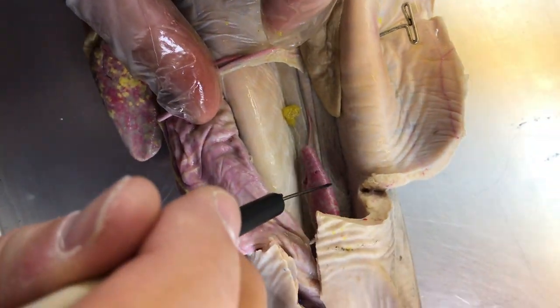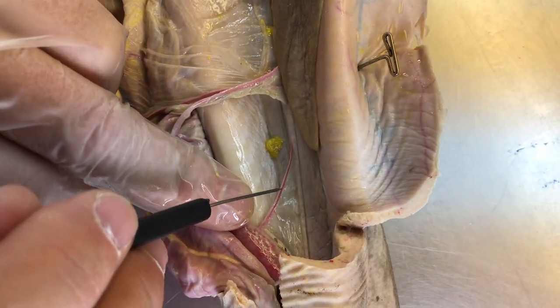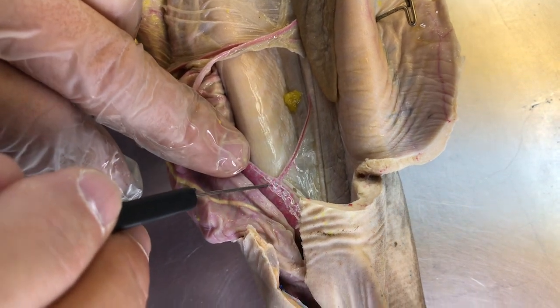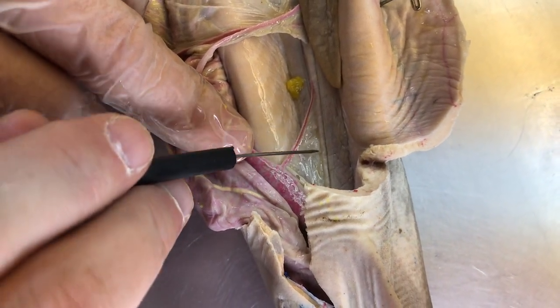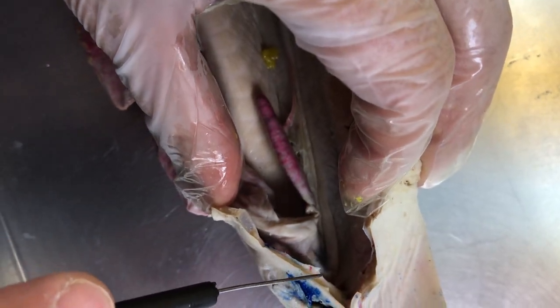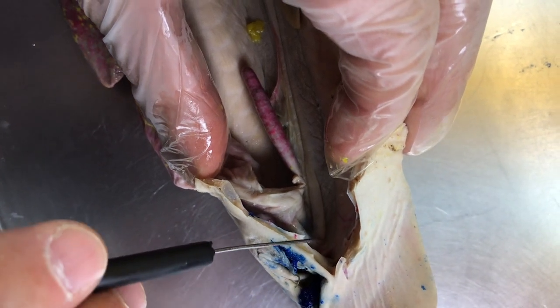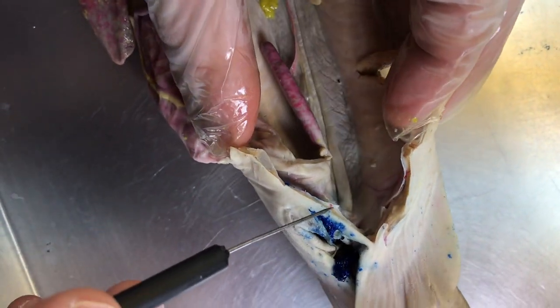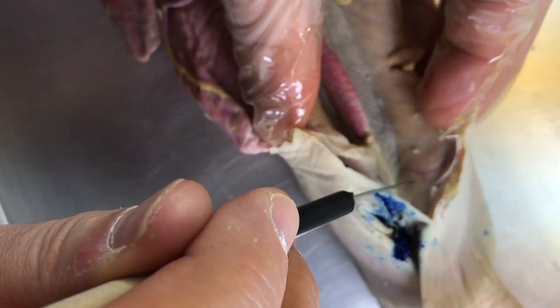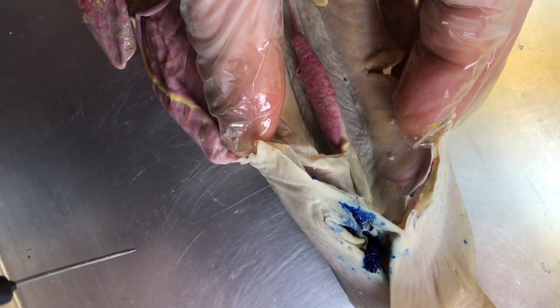The next artery is going to be this one right here, and this is the posterior mesenteric artery, and that goes from the dorsal aorta up to the rectal gland. Now, beyond this, the dorsal aorta, we can't really see it here, but it will split into the two pelvic arteries, and then it'll continue on as the caudal artery. Now, what we can see here is the posterior epigastric artery, a little bit right there. This is a branch off of the pelvic artery.